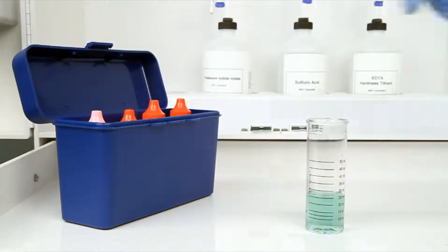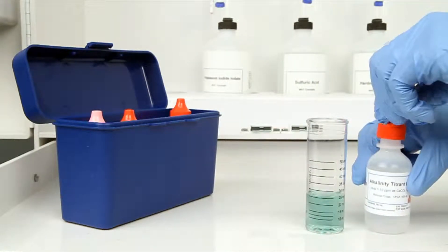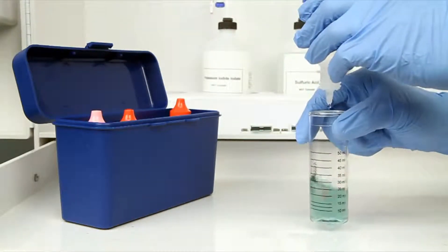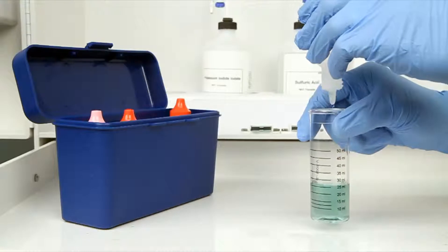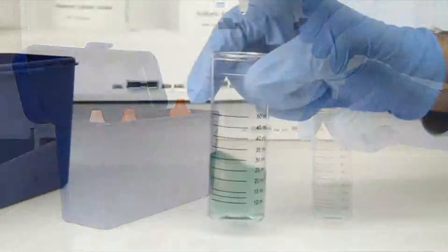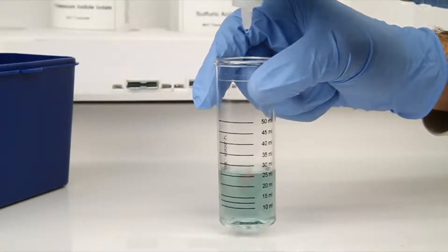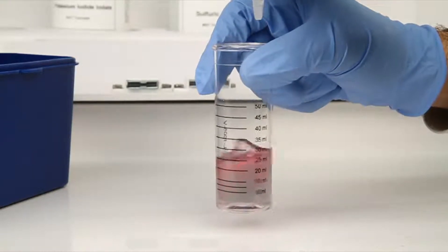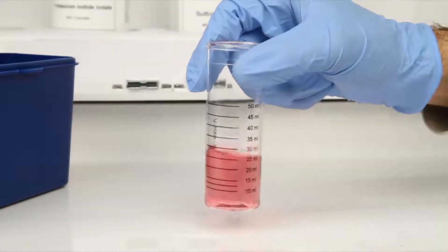The next step according to the endpoint ID procedure is to perform the titration. The bottle of titrant contains a dropper tip, therefore it's important to hold the bottle vertically to make sure you get a consistent drop size. After the addition of each drop of titrant, you want to swirl the vial to make sure the sample is properly mixed. The titration is complete when the sample is changed from green to red.